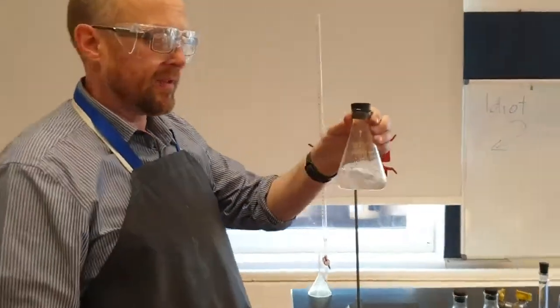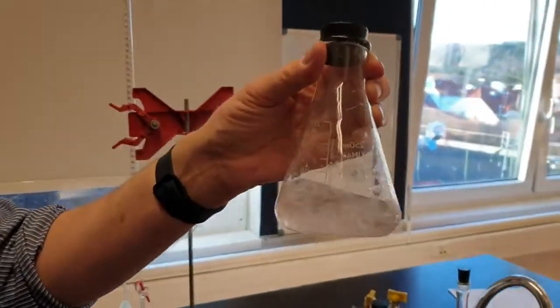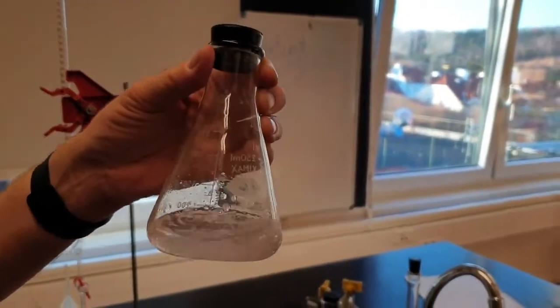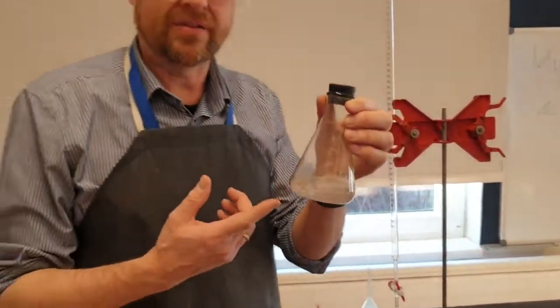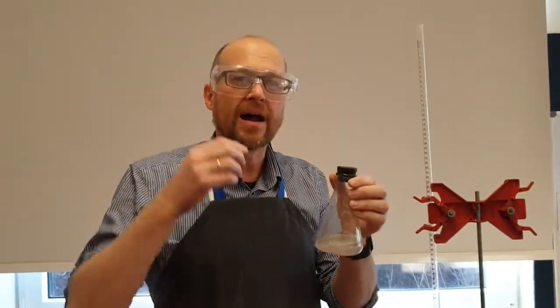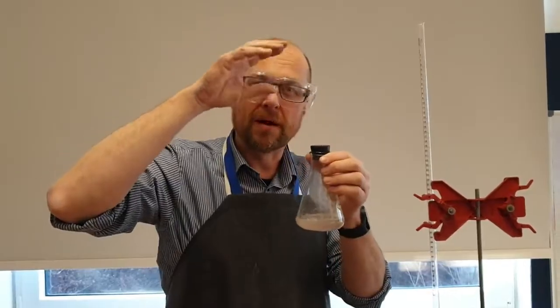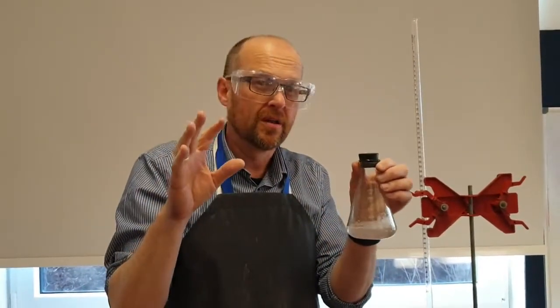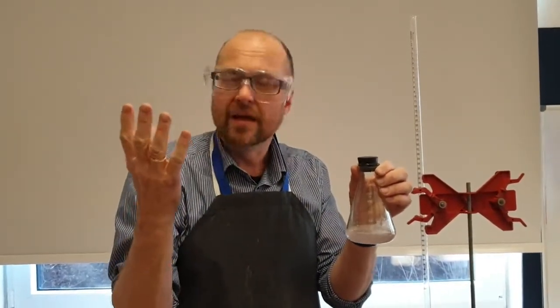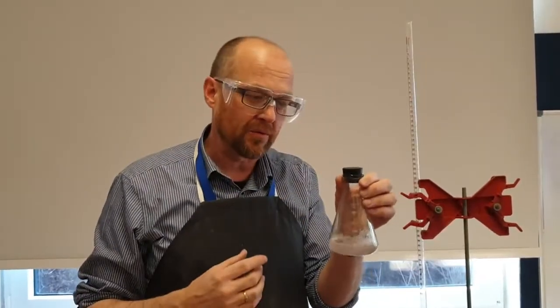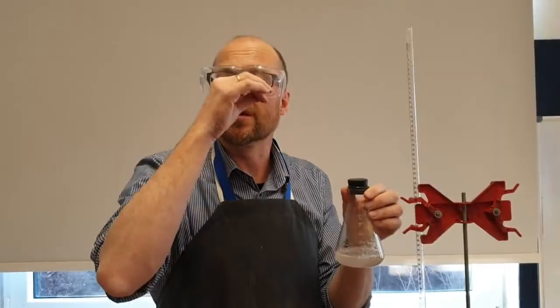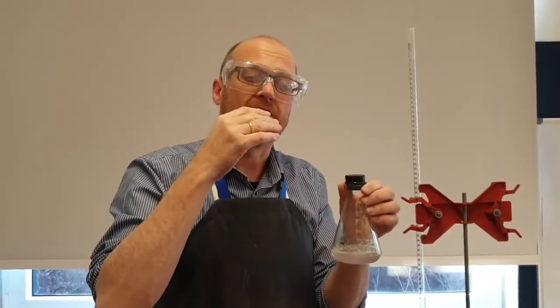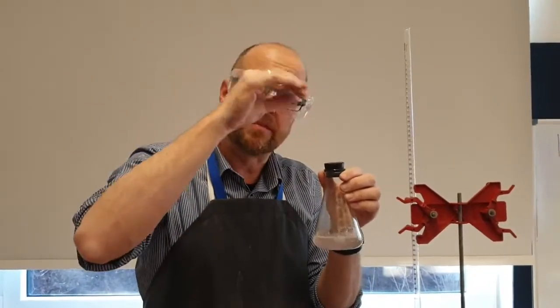So it's been a few days and the hydrochloric acid has reacted with all of the eggshell. Now I added too much hydrochloric acid in here to make sure it all reacted. Why didn't I add just enough drop by drop and when the fizzing stops I know exactly how much acid and therefore exactly how much calcium carbonate was present? Well, that would work but it takes so long as you get slower and slower as the reactants become less and less. So that's crazy, that will take you hours.